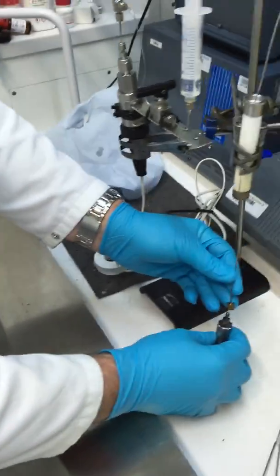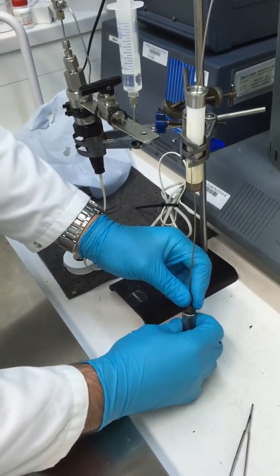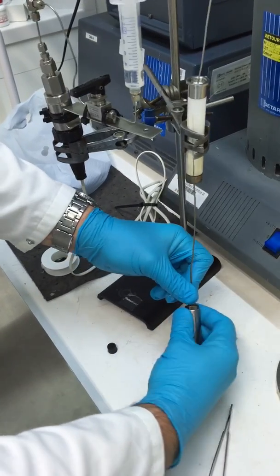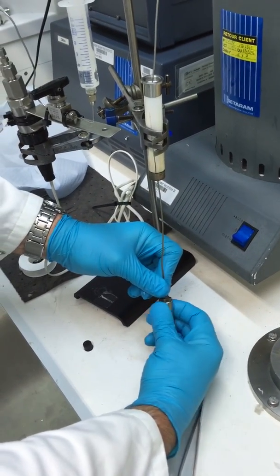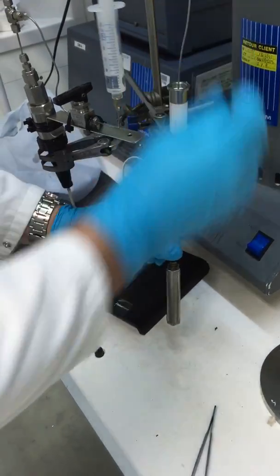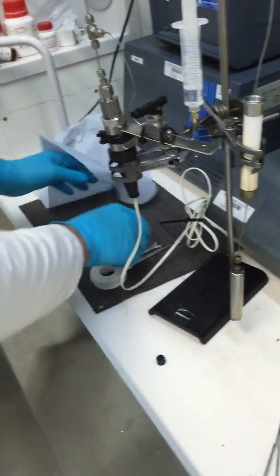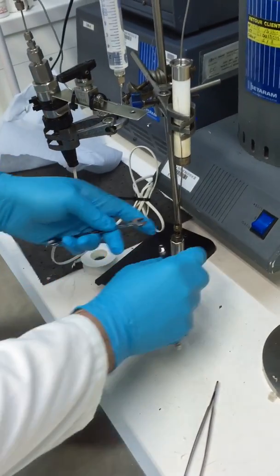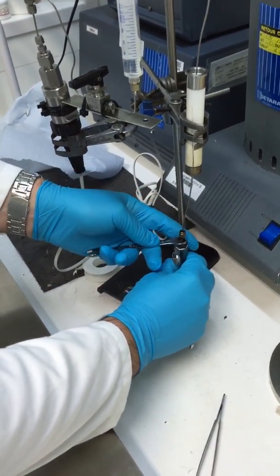We now connect the nut up to the 16th inch straight-through connector, initially hand tight. Once that is finger tight, we then obtain our two spanners and tighten that up as you would a normal swage lock nut.